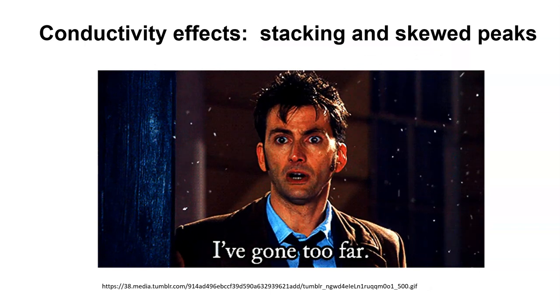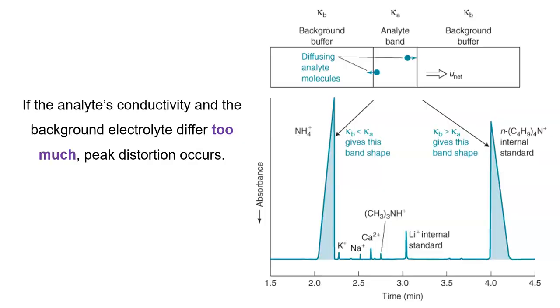But of course, you can go too far. And if you go too far, you'll get things like this. You want a difference between your analyte solution and your background, but it can't be too much of a difference, right? There is such a thing as too much of a good thing. This is what happens when you've gone too far. Now, these shapes should look familiar. It looks like fronting and tailing. Now, the difference here is the cause of the fronting and the tailing. If you've got these types of shapes in CE, you know exactly what happened. You just went a little bit too far with the differences between the sample solution and your background buffer.